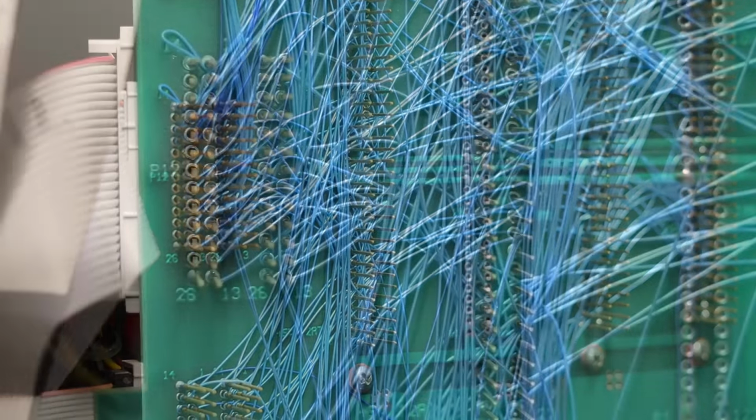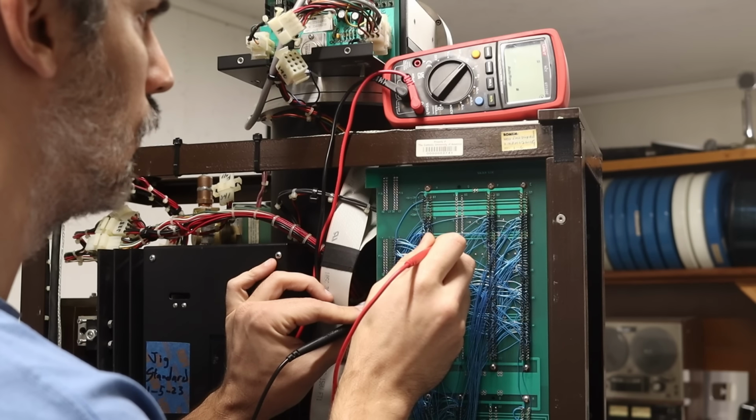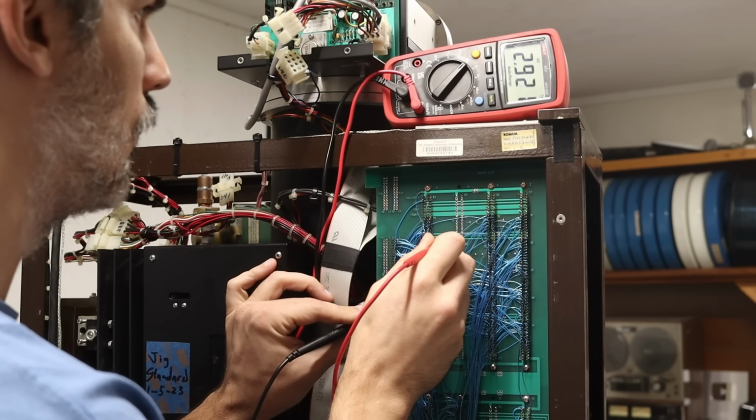And I can see that the wire wrap wire that goes from the pins that I care about on J11 goes straight up to this card edge connector right here on the top left. And it goes to 3 pins that make perfect sense, because those 3 pins have traces that go to them that carry the plus and minus 15 volts with the plus minus 15 volt return. However, if I check the connection to the pin, that's good. But if I check the connection to the trace, that's bad, which is very weird.